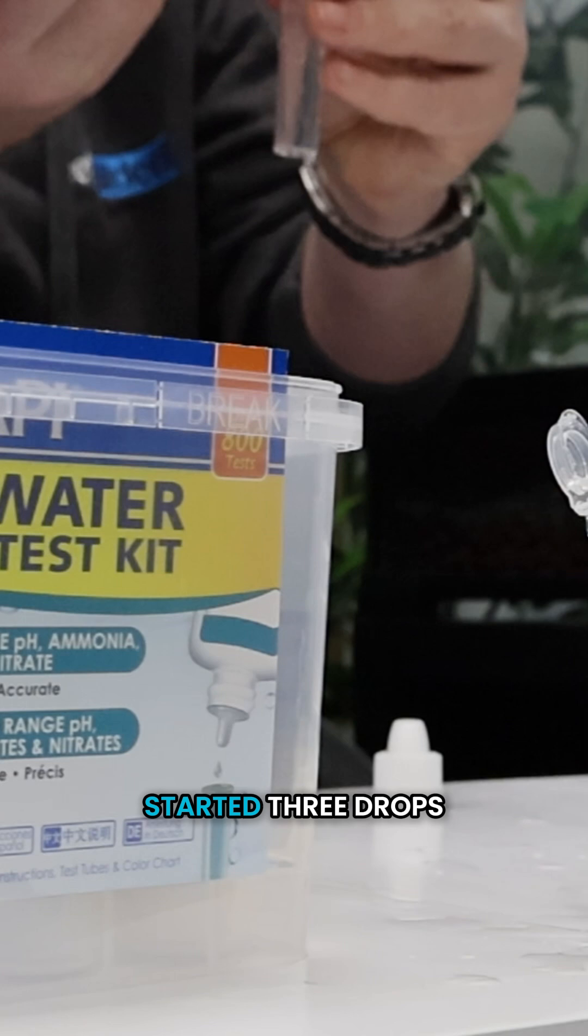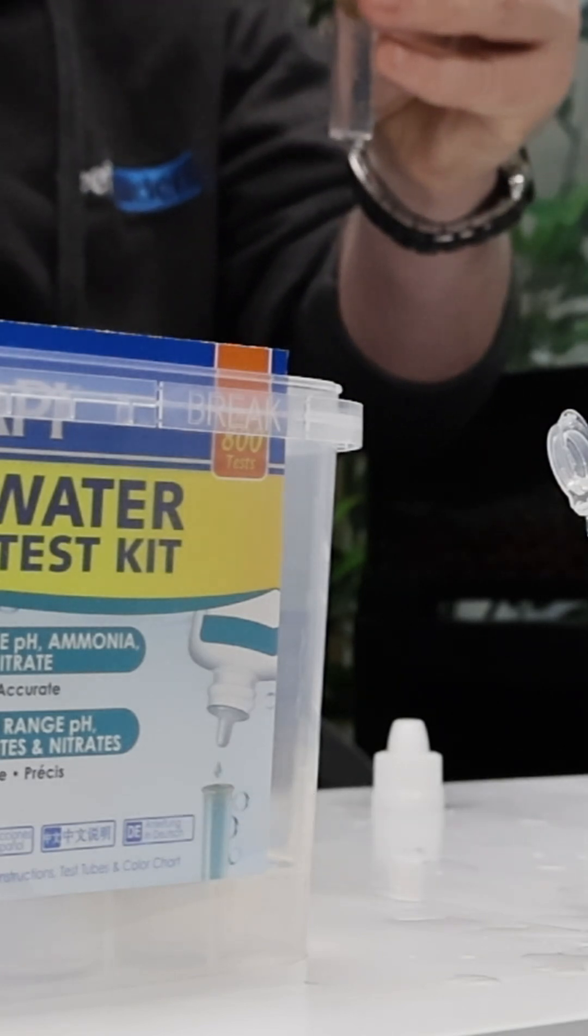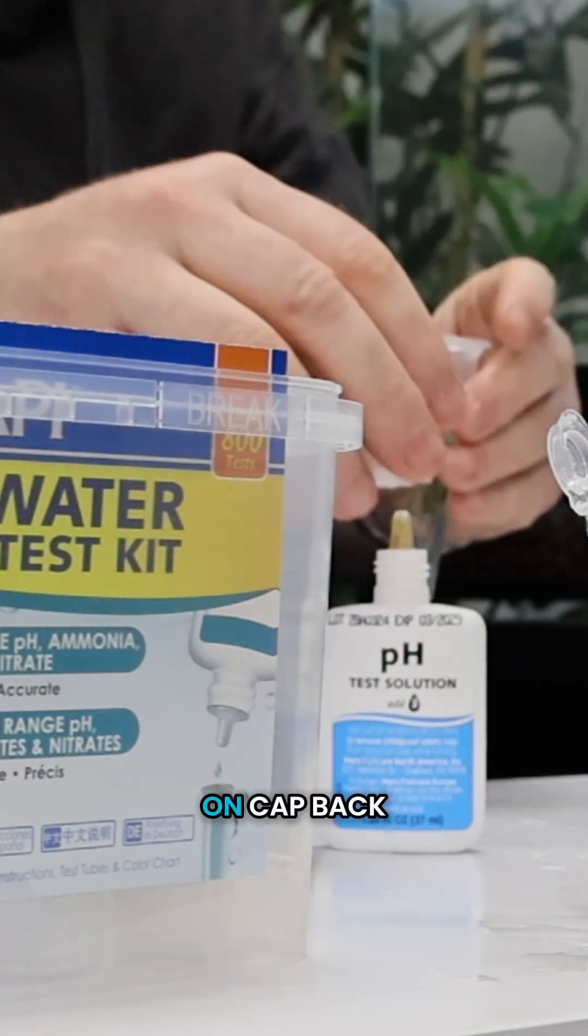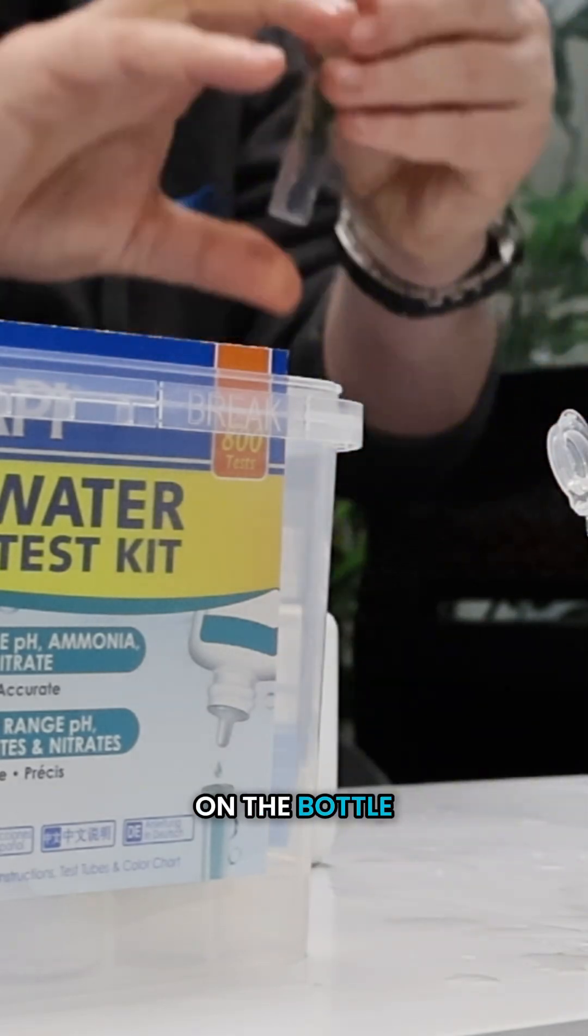So let's get started. Three drops, three. Put the cap on, cap back on the bottle, give it a shake.